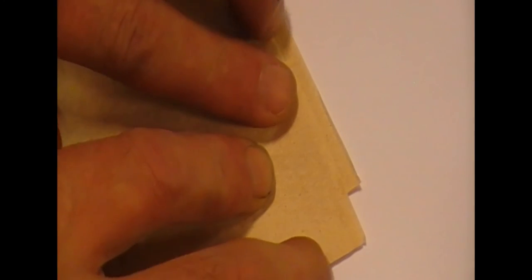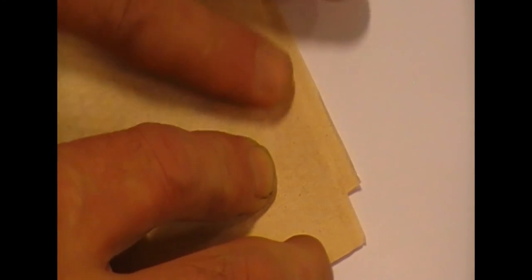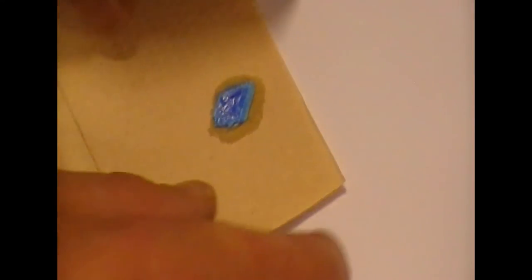If you place it on a paper towel, just dab it dry. And you can see the very regular crystalline structure of that copper sulphate crystal.